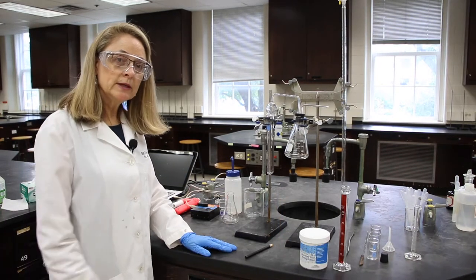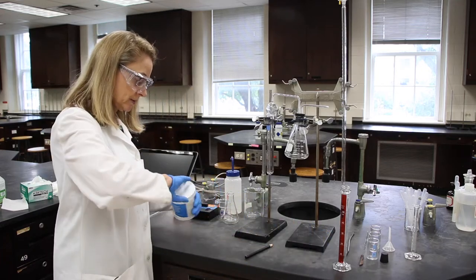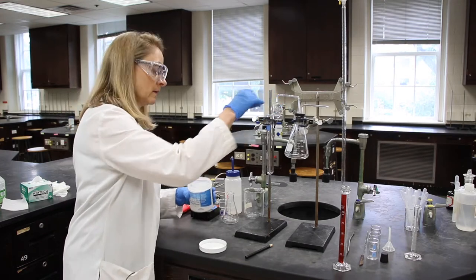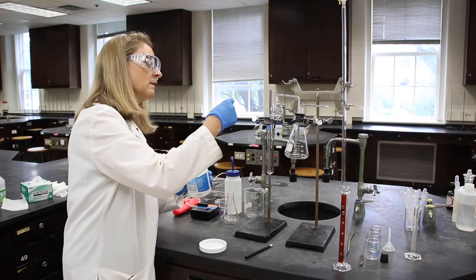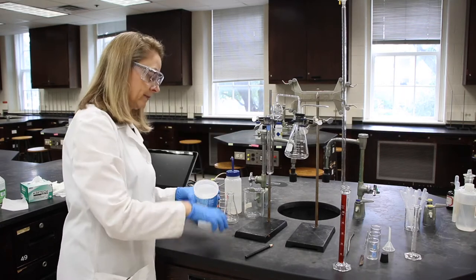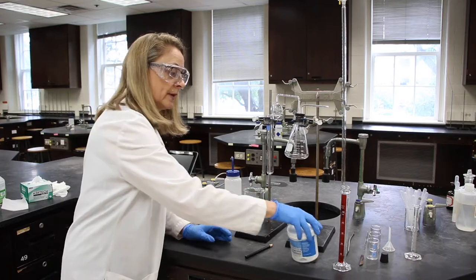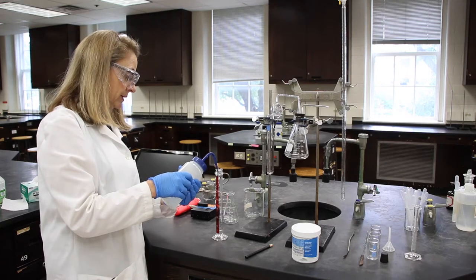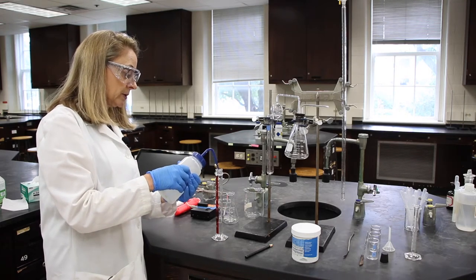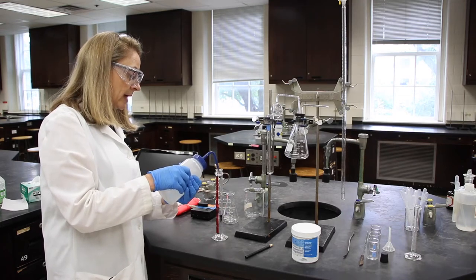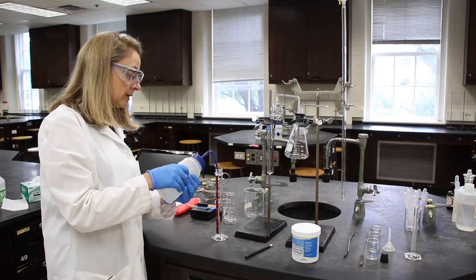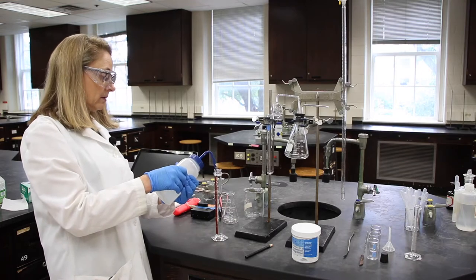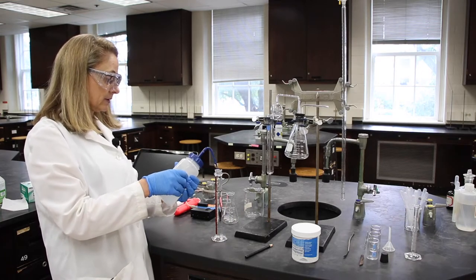In step one, we'll need to add two boiling chips to our test tube. And these will ensure smooth boiling. And we'll also add 50 milliliters of water to a graduated cylinder. And this needs to be carefully measured. So be sure you get it eye level and measure at the 50.0. And that's three significant figures for this piece of equipment.